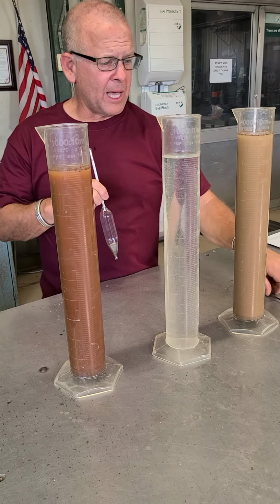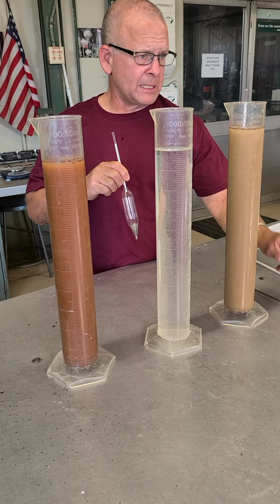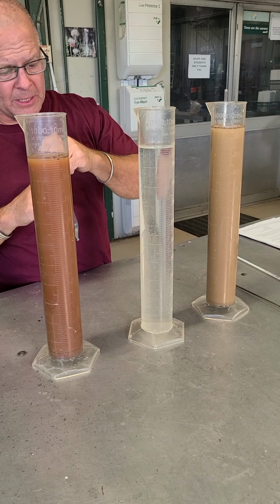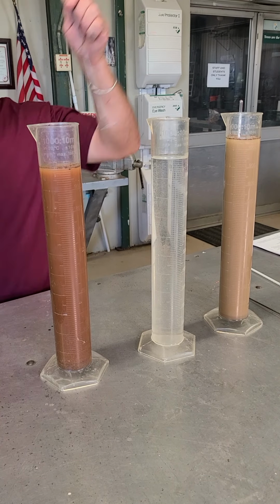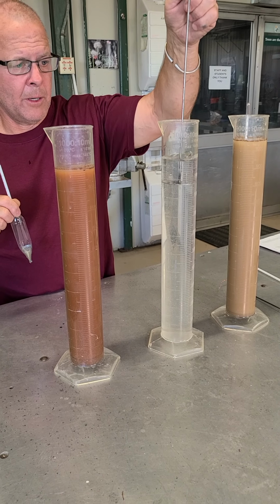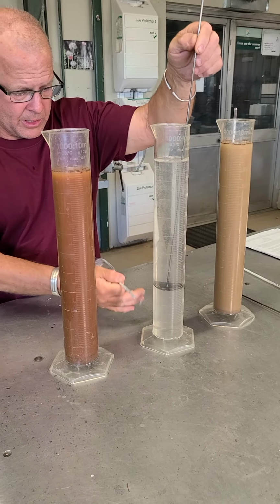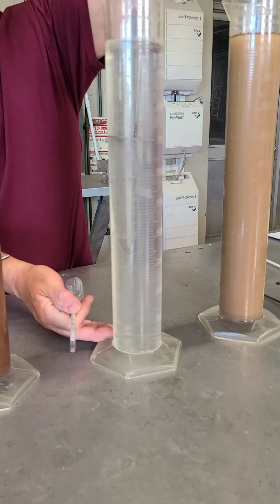I'm not going to do that, but let me grab a clean one of these, just so I have a clean one. What I'm going to do is simulate doing everything the same, right? Whoops, a little drop there. See how you can get inaccuracies no matter what. So I'm going to do the same thing and make sure that everything is mixed up.